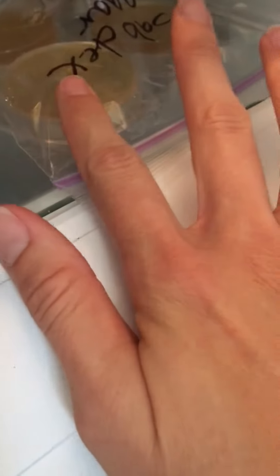I'm going to take them and stick them in my refrigerator right here. You need to store them jelly side up, otherwise you get a lot of condensation in them and we don't really want that. If you were taking this lab in person, we would always store the plates jelly side up — that's part of proper storage for plates. So you're going to take both sets and place them in your refrigerator.